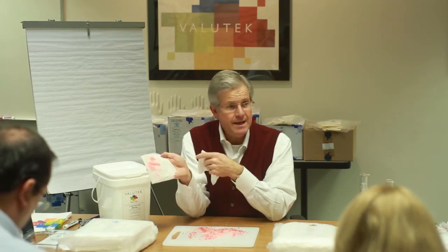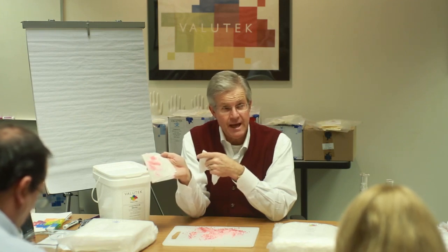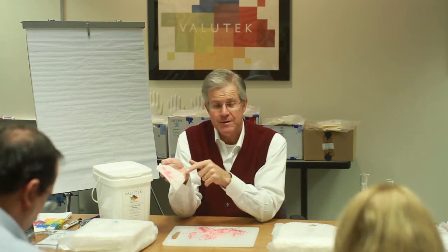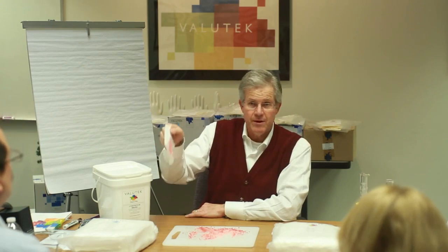The reason why the particles cling, I call it PAT, particle attraction technology. Some of this has to do with cations and anions. When you saturate a wiper with isopropyl alcohol, you change the chemical properties of the wiper, and the wiper is actually going to attract particles. Particles are going to cling. And you see the moisture on the wiper causes the particles to still cling to the wiper. Even after repeated shakings, this wiper is still retaining the particles.